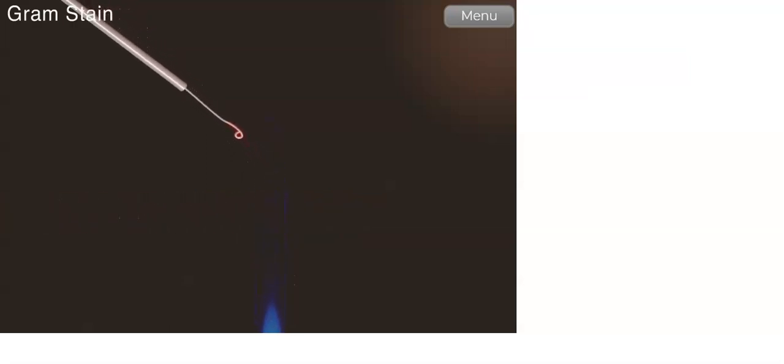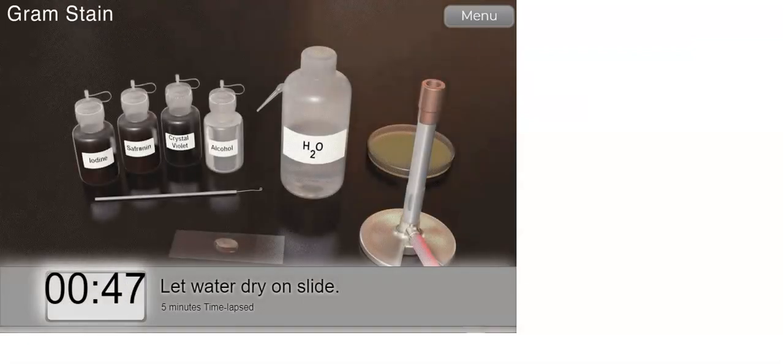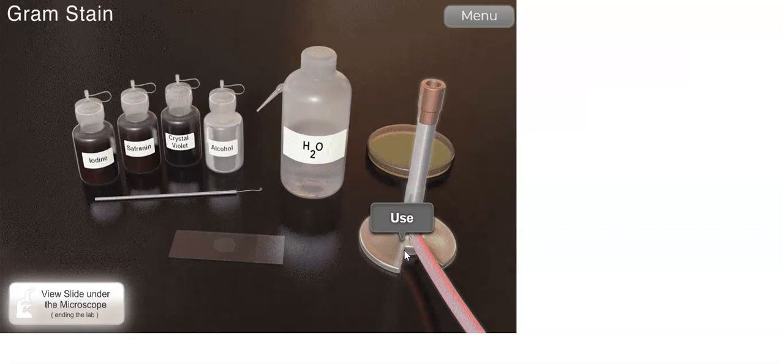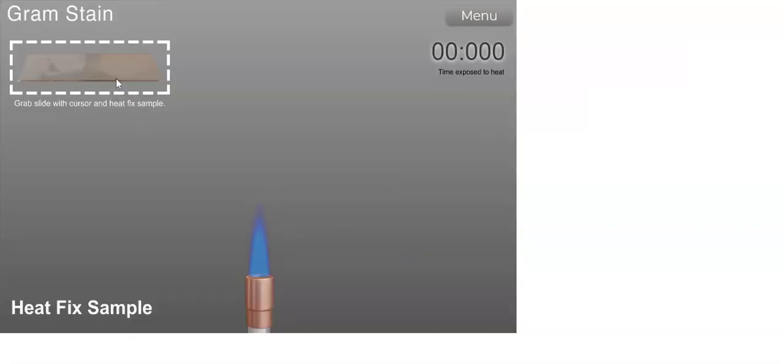First of all, we will heat the inoculating loop until it becomes red hot, to remove the impurities and contaminants and avoid contamination. So let the water dry on the slide, then we're going to start the heat fixation process. Okay, heat fix the slides. Light the Bunsen burner and just pass the slide around two or three times, about 1 to 2 seconds.